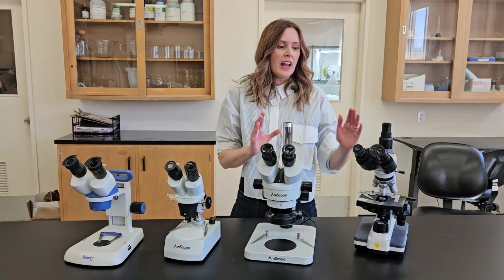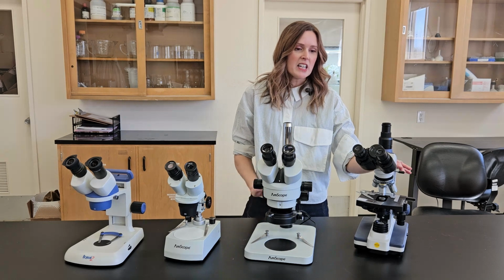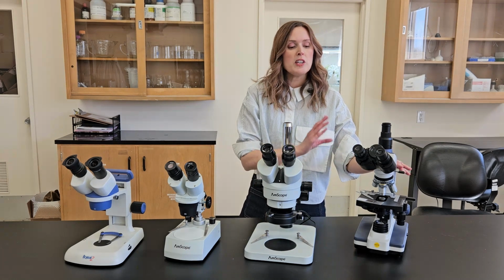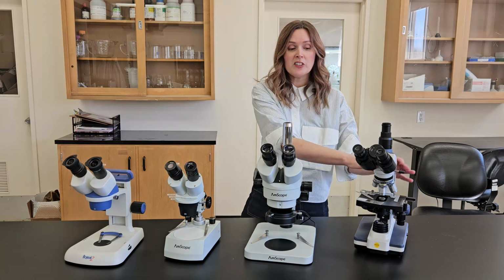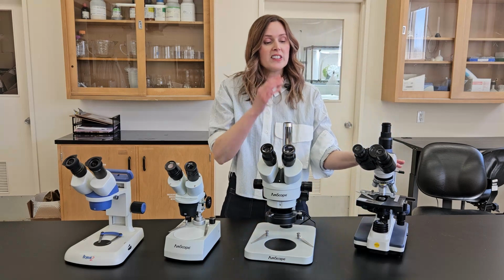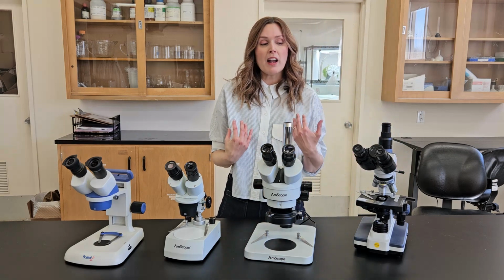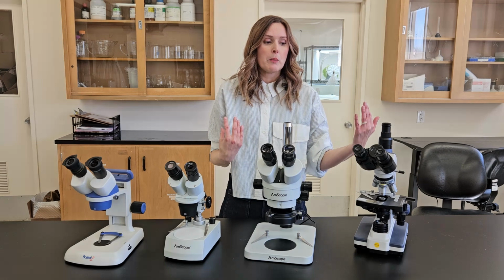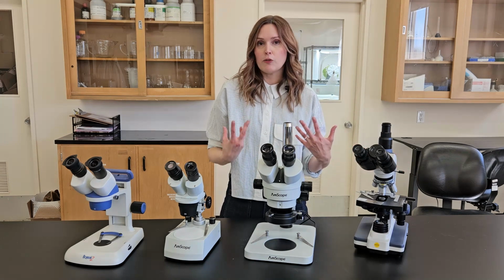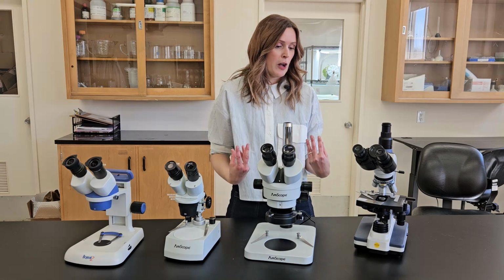And even though we said at the beginning that a compound scope might be more than you need most of the time, we do have growers buying cheaper versions. This version is actually, again, only around $400 to $500 versus the compound scope I have in my lab, which is $5,000. But we find them almost indistinguishable now, or at least for thrips identification, there's not that big a difference.